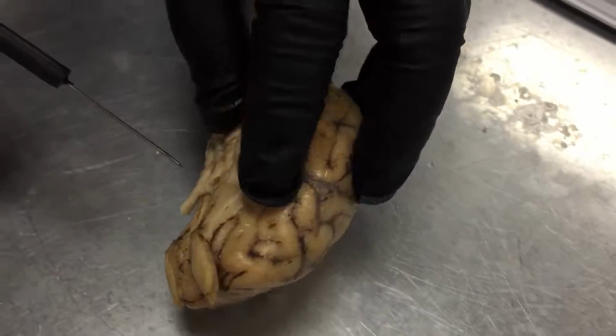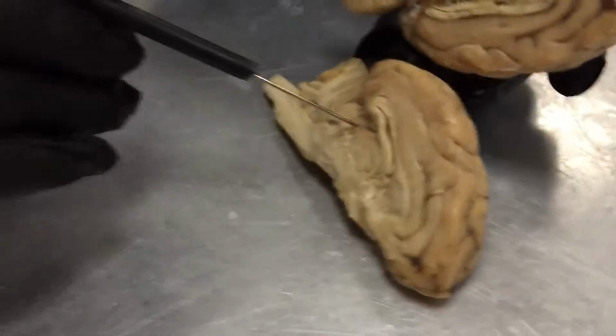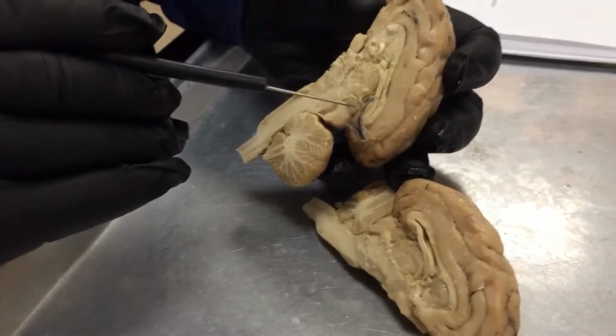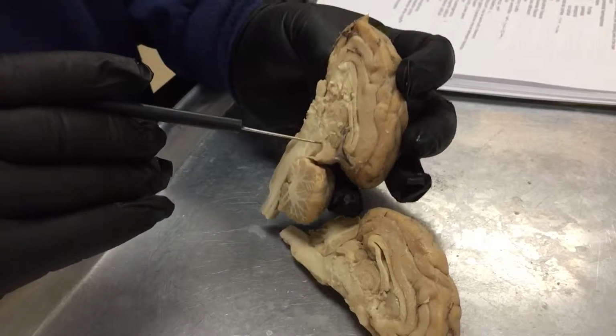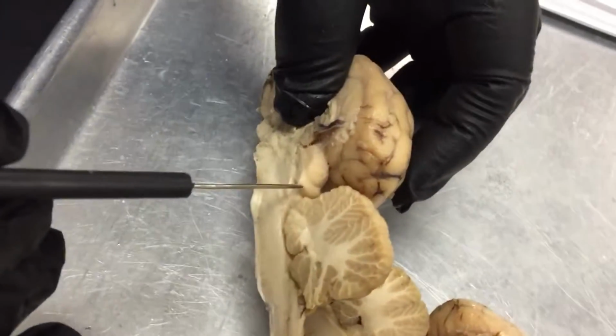And then we have the pineal body, which is going to be right here. So we could see it on both brains. It's right here, this little circle, and then right here on this little circle, which is right anterior next to the corpora quadrigemina, in which we have the superior colliculi and the inferior colliculi. And I'll put the brain back together so we could see all four right there.